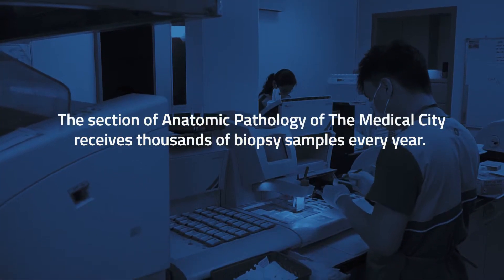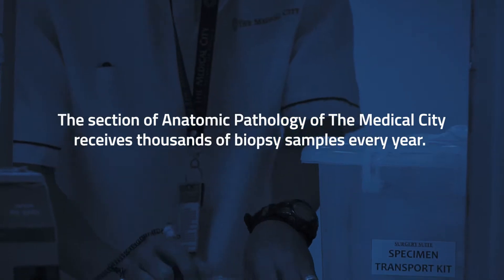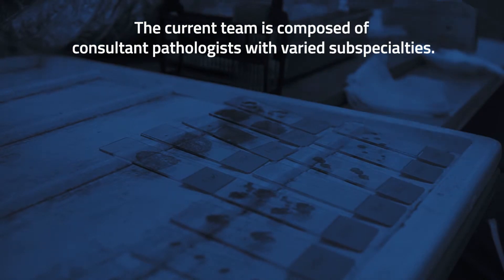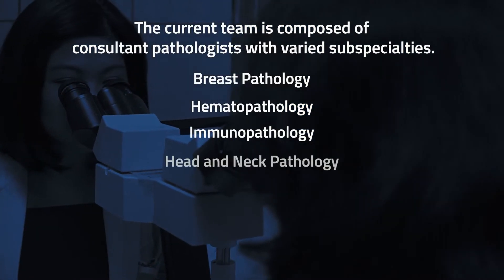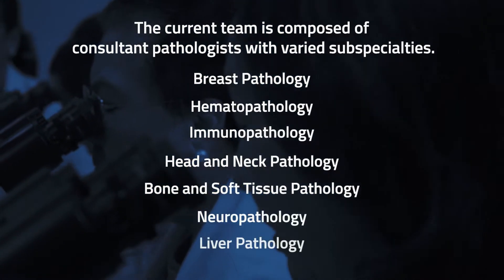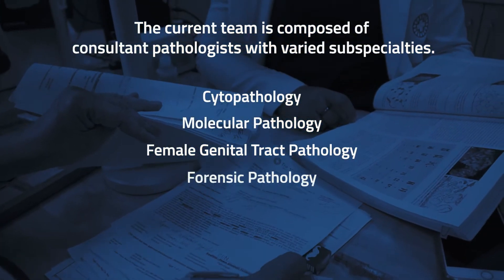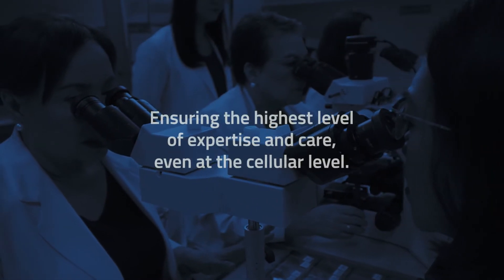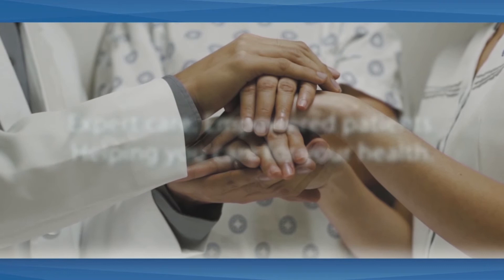The Section of Anatomic Pathology of the Medical City's Department of Laboratory Medicine and Pathology receives thousands of biopsy samples every year. The current team is composed of consultant pathologists with subspecialties in breast pathology, hematopathology, immunopathology, head and neck pathology, bone and soft tissue pathology, neuropathology, liver pathology, cytopathology, molecular pathology, female genital tract pathology, forensic pathology, and renal pathology, and continues to grow, ensuring the highest level of expertise and care even at the cellular level. The Medical City, where patients are partners.